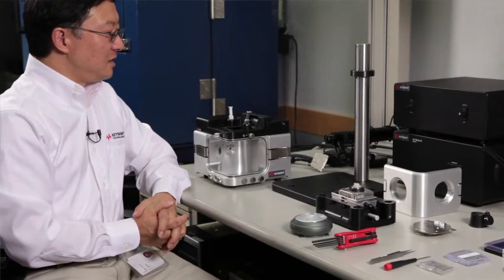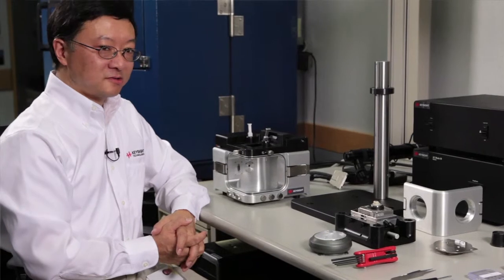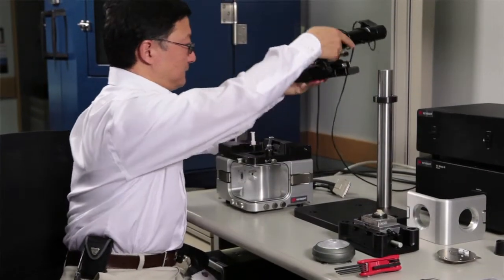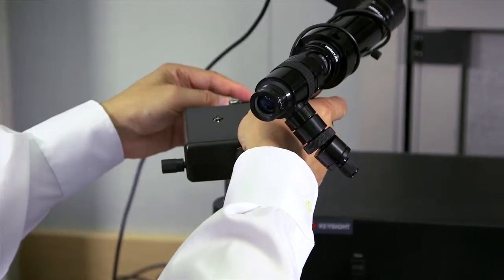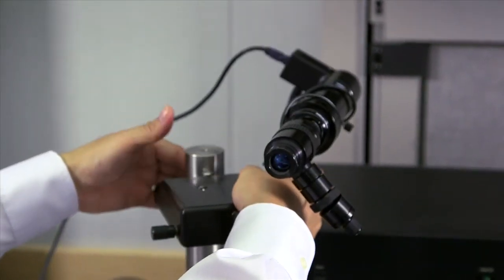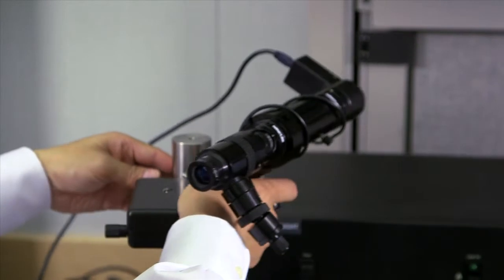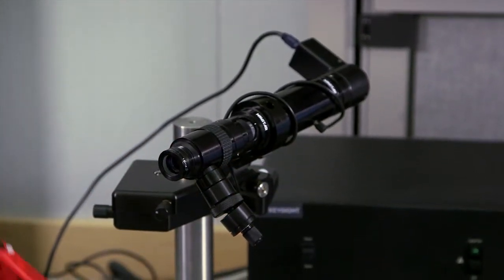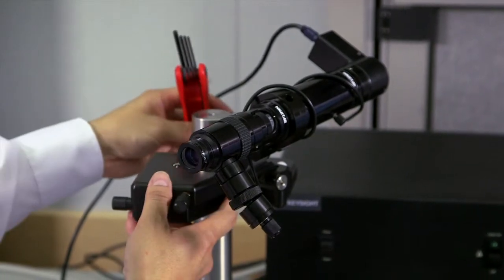First, we will put up the optical microscope assembly. Slide down the column, rotate to its position, then use the Allen key to tighten the screws.